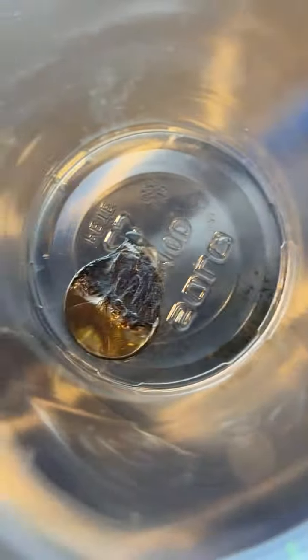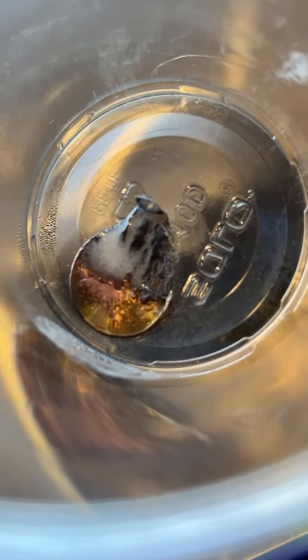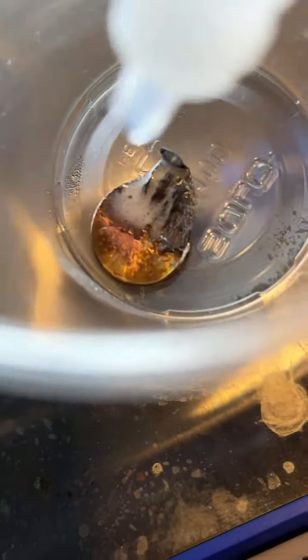So forgive me, I'm trying to do this and film at the same time. And this is not the easiest thing in the world to do. But let me just go ahead and add a few drops here. Oh, yeah, look at that. You see those bubbles? That's the reaction I would expect to see. You'll notice it only happens with the zinc and not the copper. Those bubbles are hydrogen gas bubbles. So I'll write down the chemical equation for what's happening here in a second. But yeah, that's hydrogen gas that's being produced. Let's add another drop. Here we go.